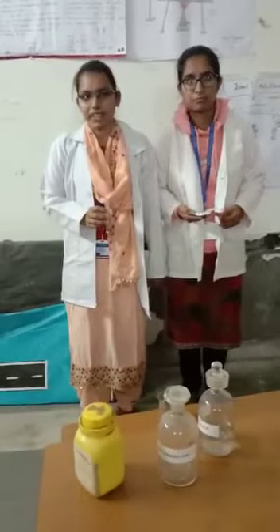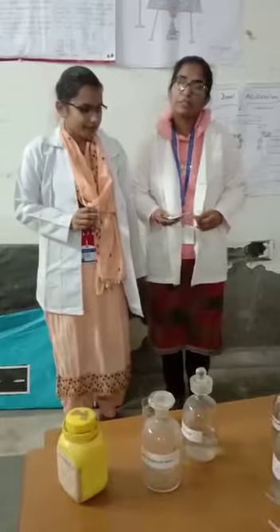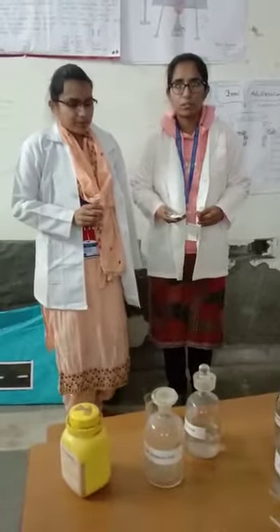Hello everyone. I am Monika from BSC Chemistry Honours Final Year. Good morning everyone, myself Jyoti from BSC Chemistry Honours Final Year. Today we are going to take the practical of CaSO4 quality testing.